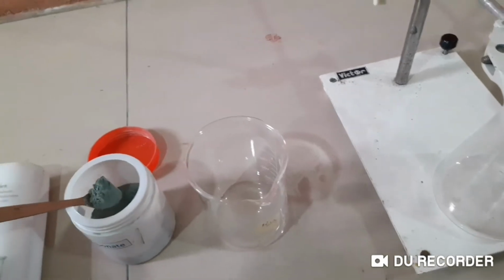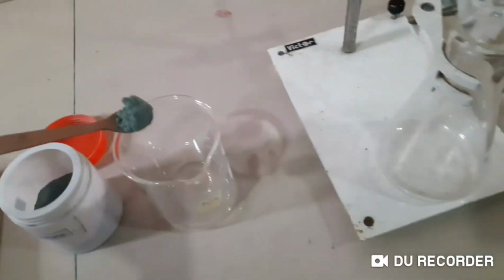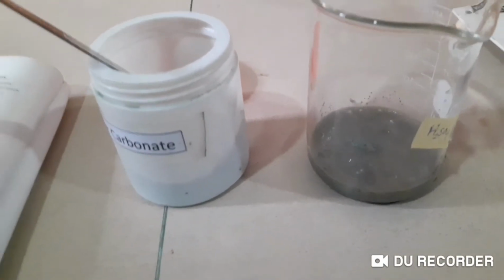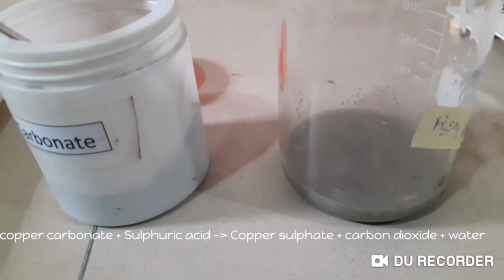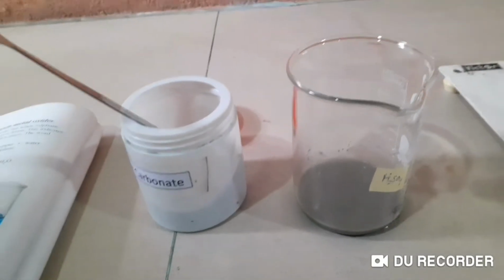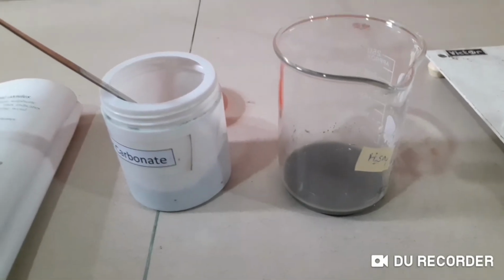Okay, let's see. Taking excess of copper carbonate, you will see the bubbling. What is the gas coming out? That's carbon dioxide coming out, right? You can see the gas coming out. That's carbon dioxide. After the reaction has completed, we'll see what remains.